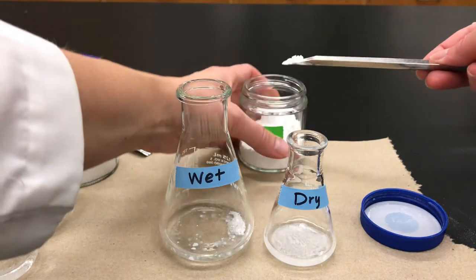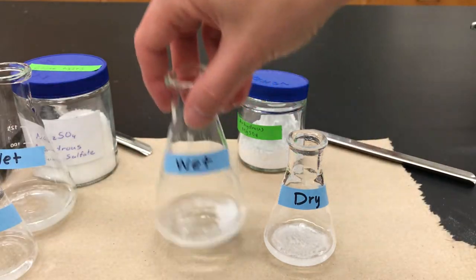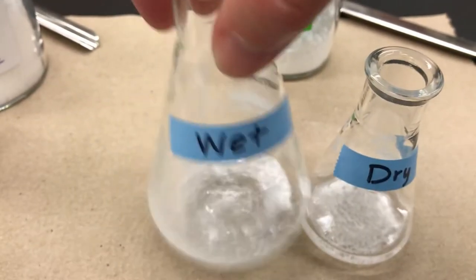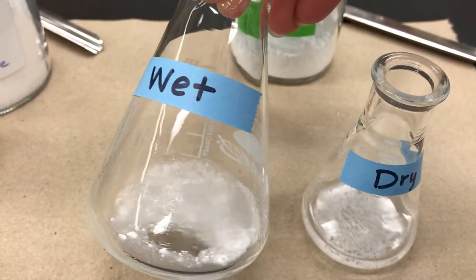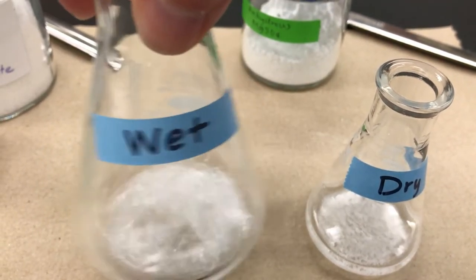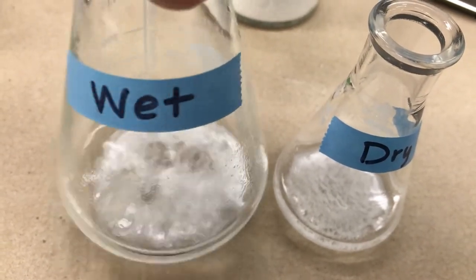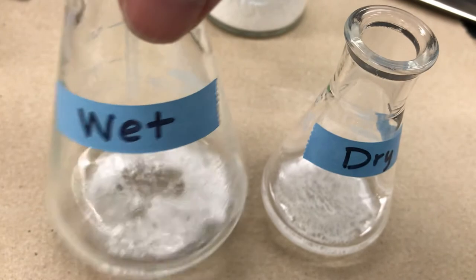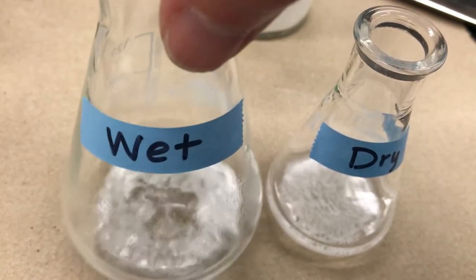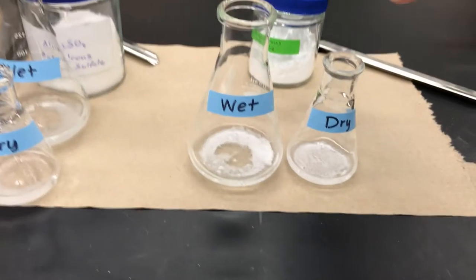If the particles are clumping, add another portion and give it another swirl. You're looking for that cloudy appearance because it means the particles are fine and being dispersed in the mixture. Give it some jiggles — you can see tiny particles that aren't stuck, moving around and quite small. That means the water has been removed from the solution and it's dry.